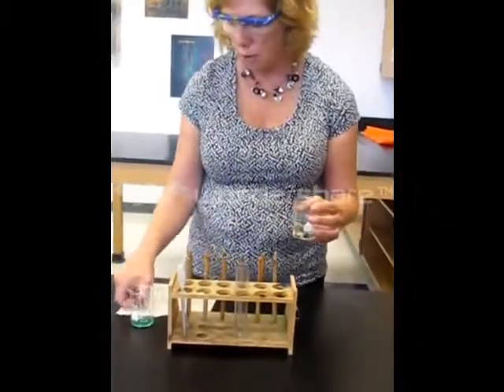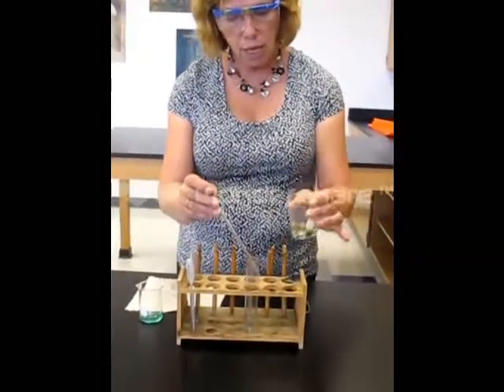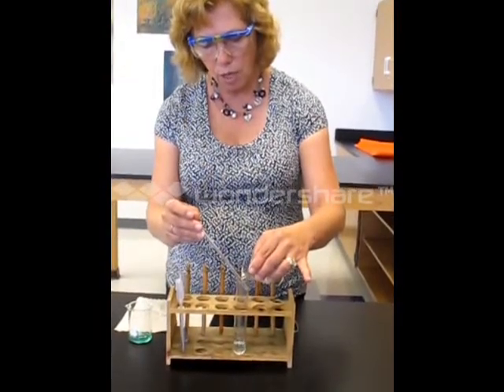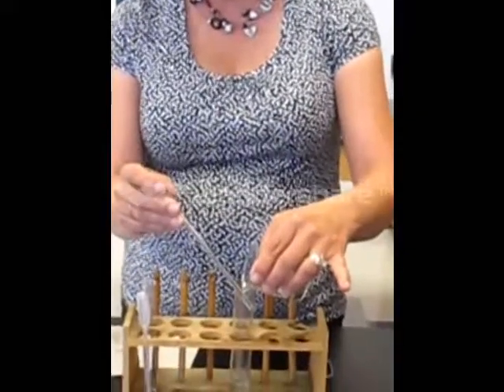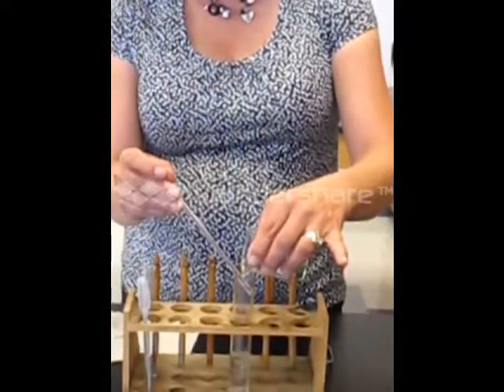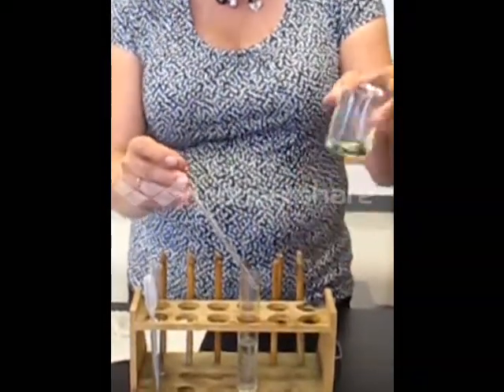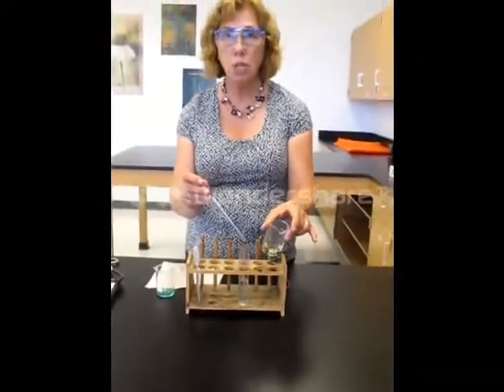I'm going to use my glass stirring rod and pour from one container into the other, but I need to do it very carefully so that none of the rocks — or the material that is not in solution — actually transfers between the two containers. What that might mean is that I have some material left that I'm not able to decant.